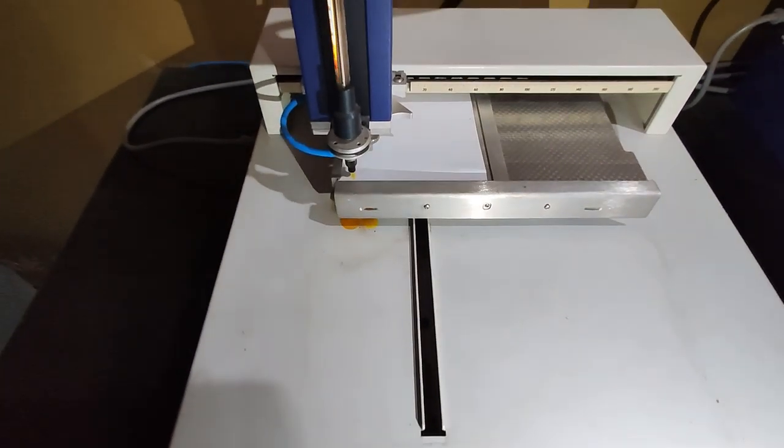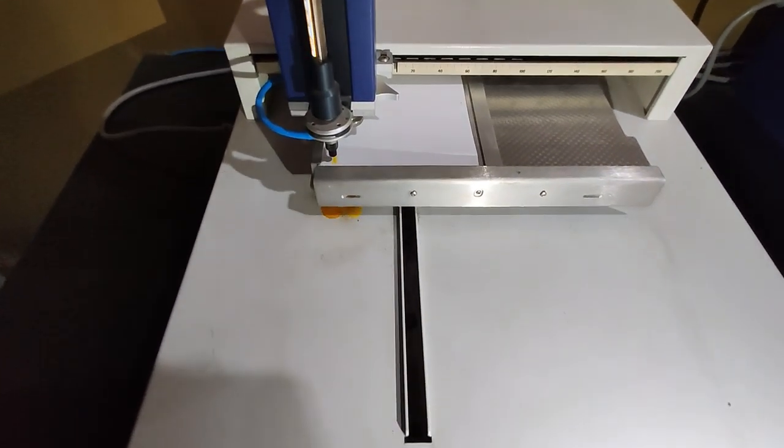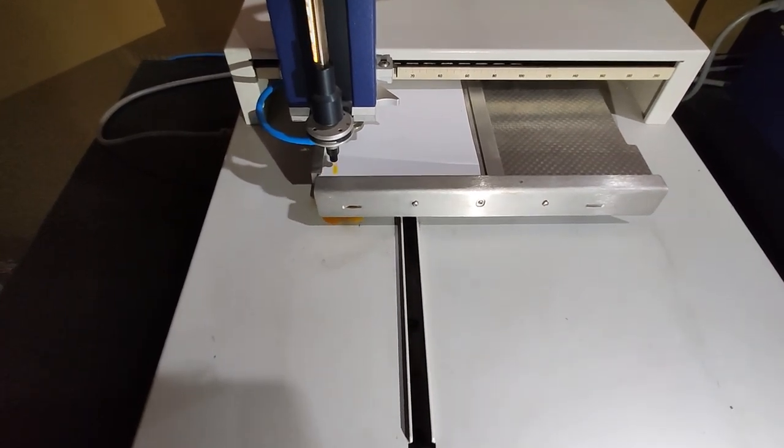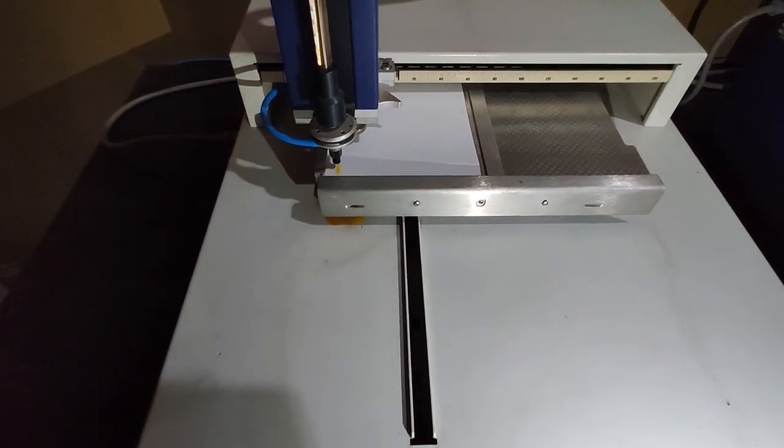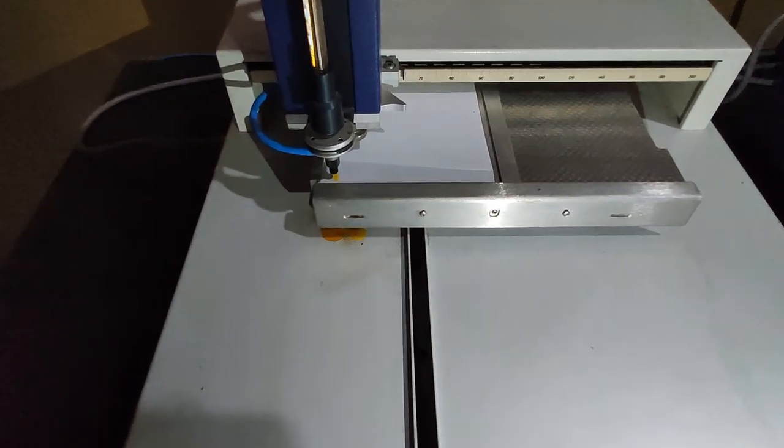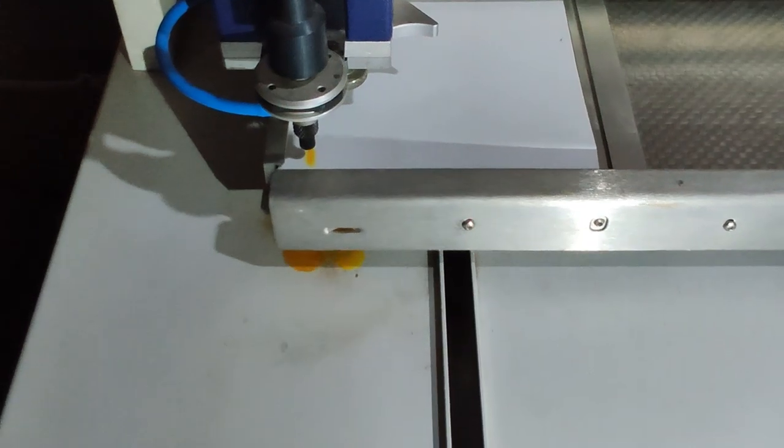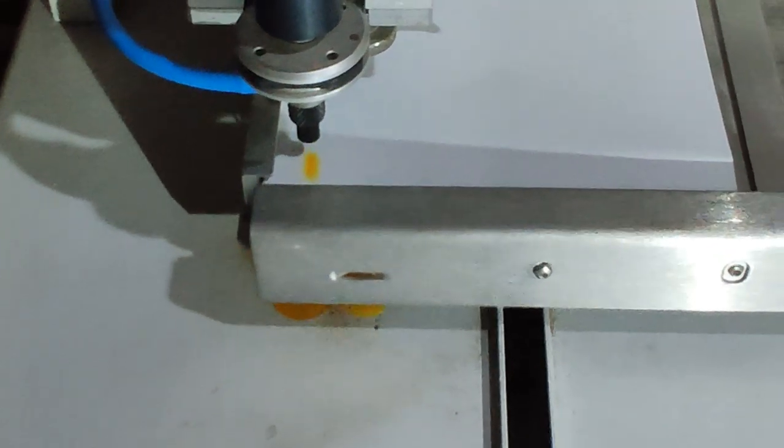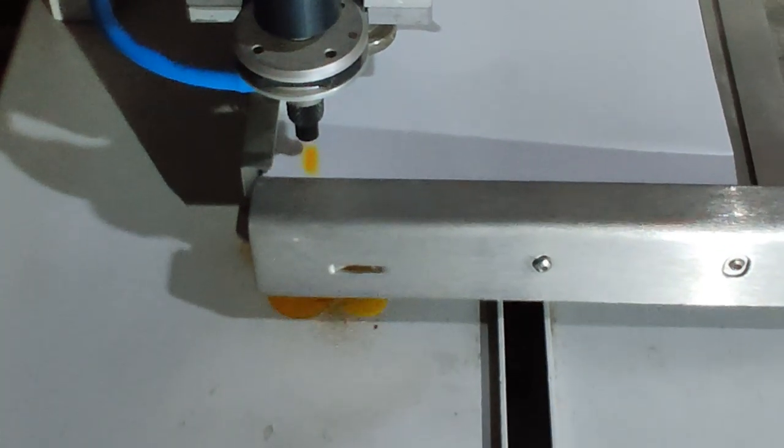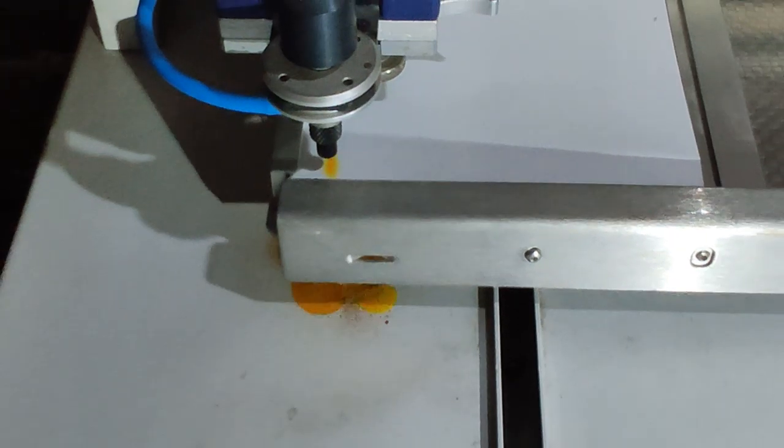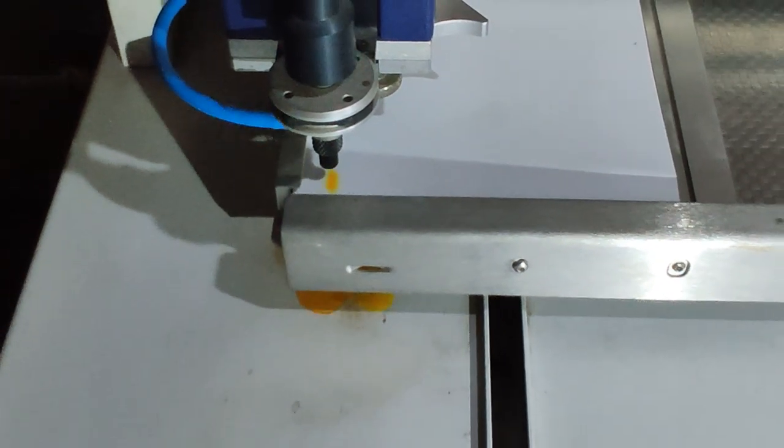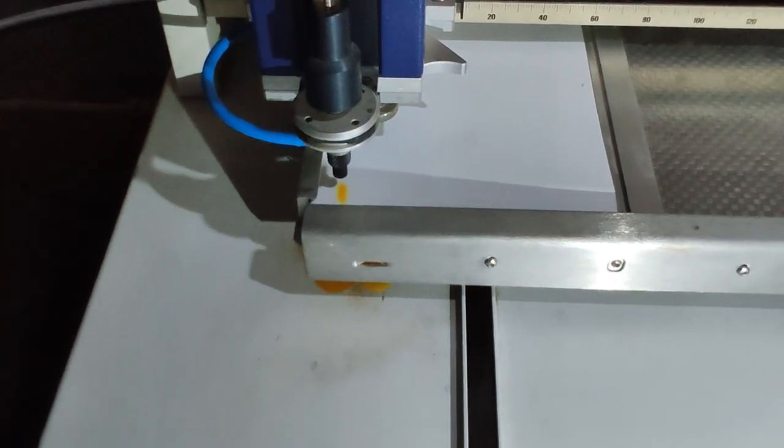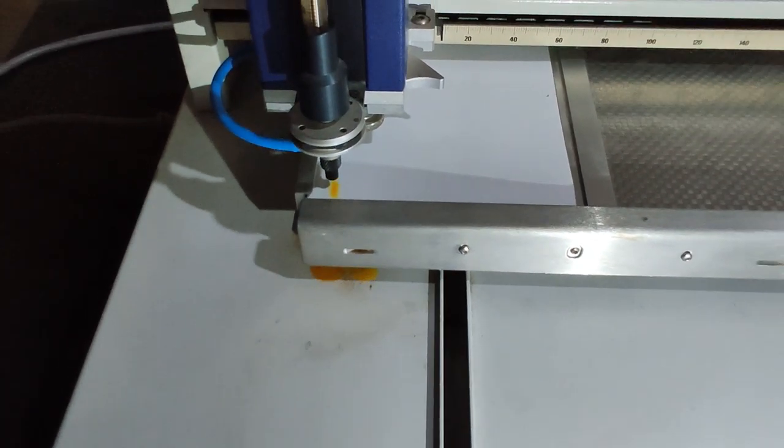This application is automatic. Only changing the syringe means filling, inserting, and rinsing is manual. Here, you can see the formation of band on plate.